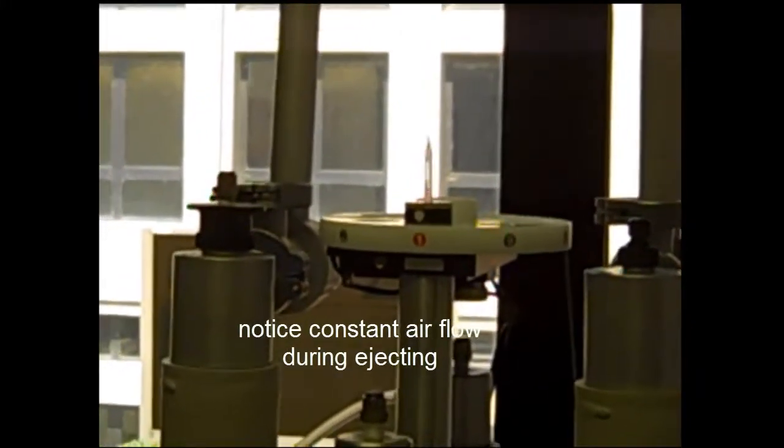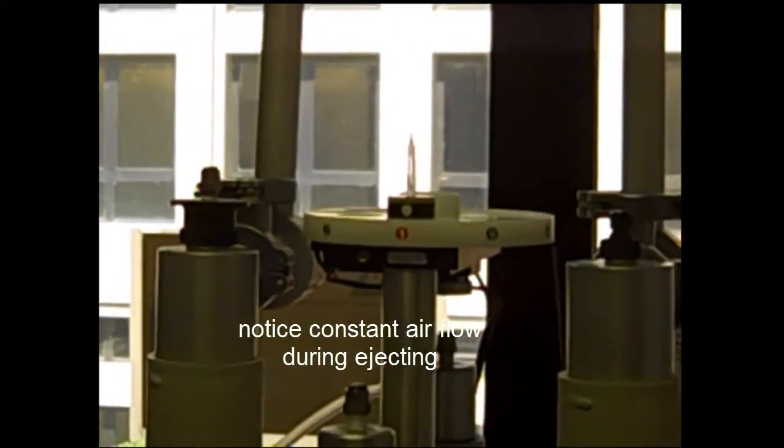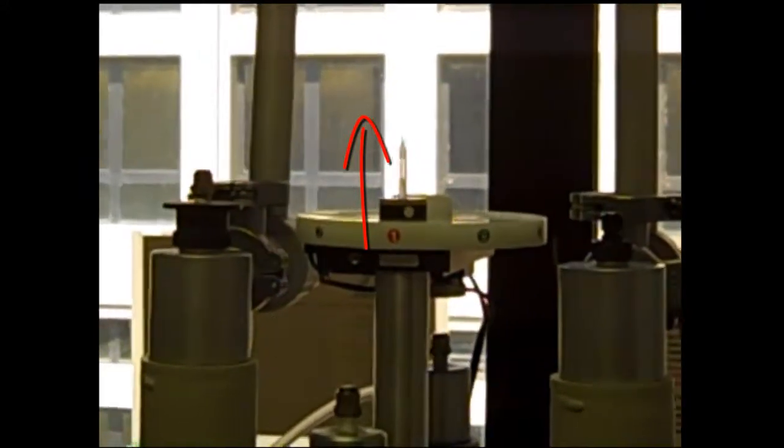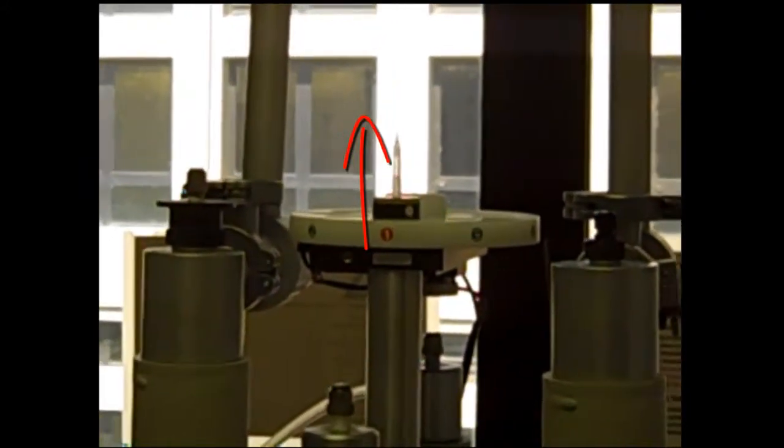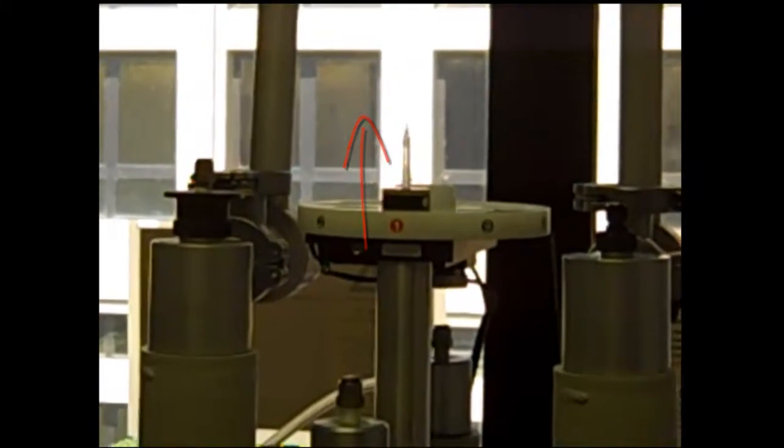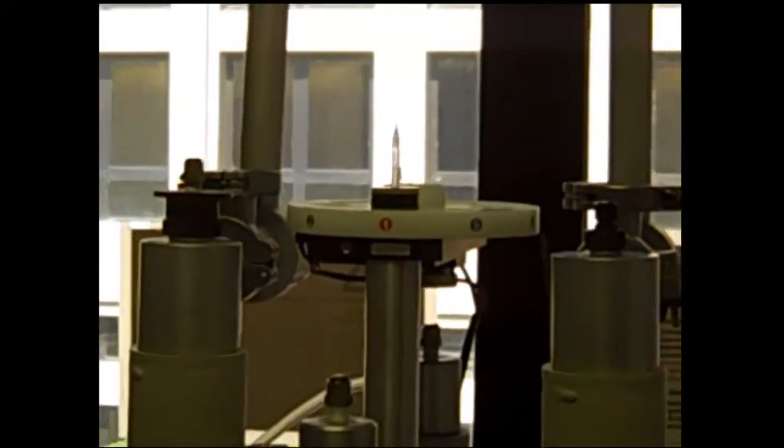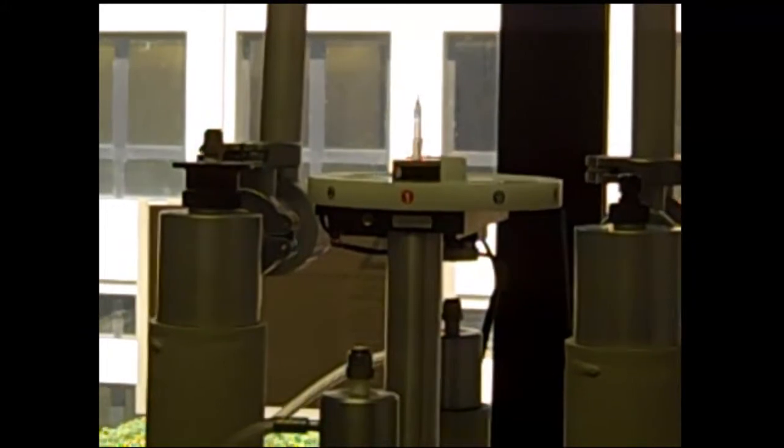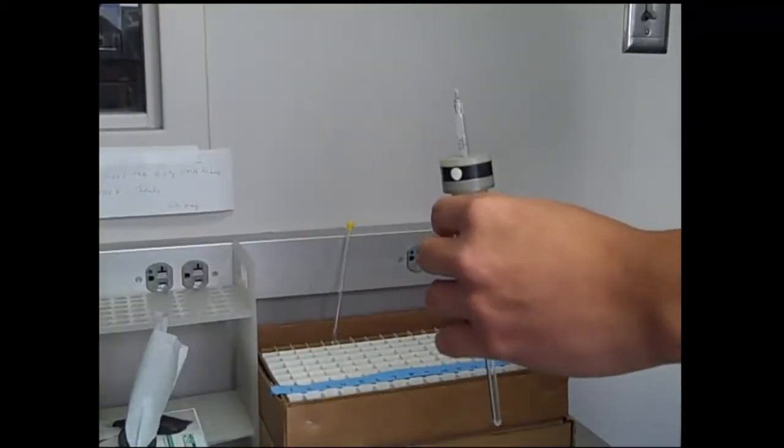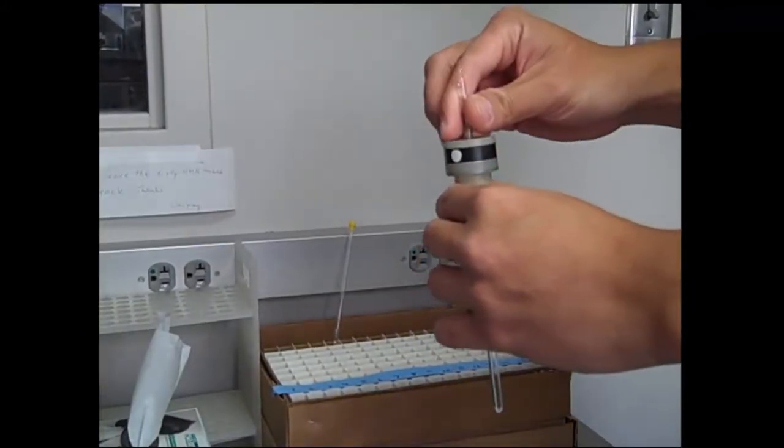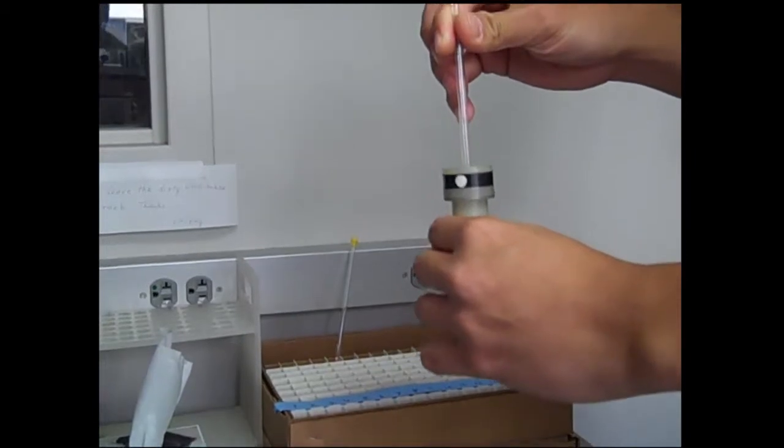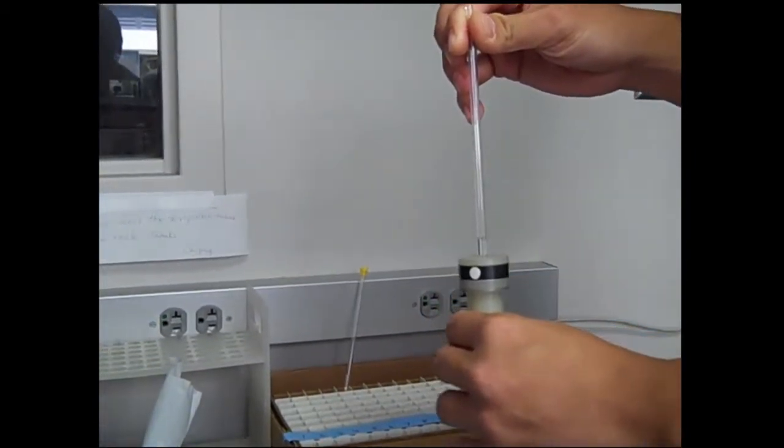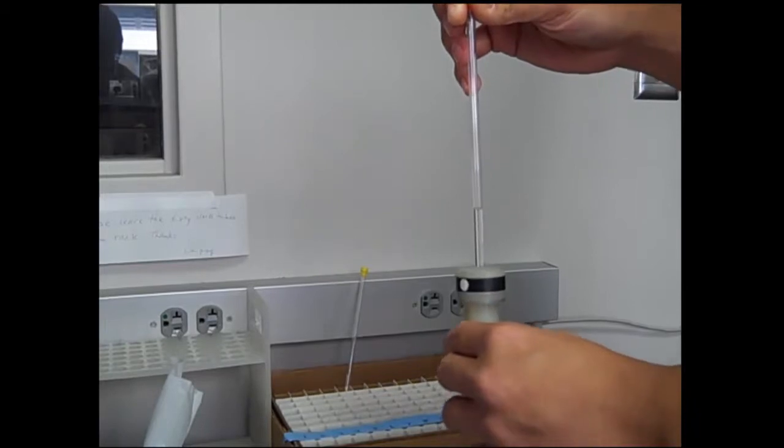When you're lifting that out, make sure you lift the plastic holder straight up and then out. If you lift it up and then start to pull away, you may run the risk of breaking the glass tube inside of that compartment, which would be disastrous and the NMR would have to be taken apart. Once you've taken out the sample in the holder, remove the sample that's currently in the plastic holder. Be careful not to break the glass tube.